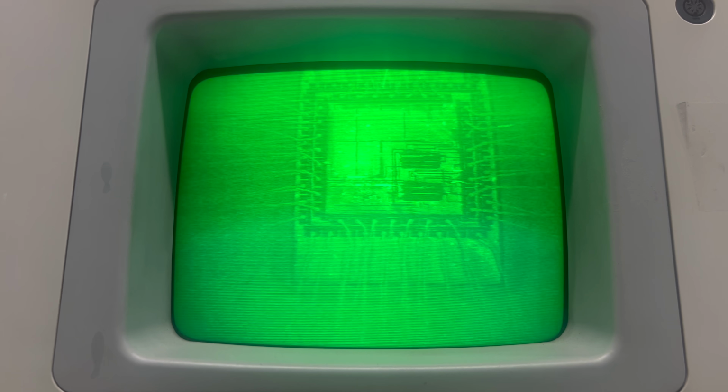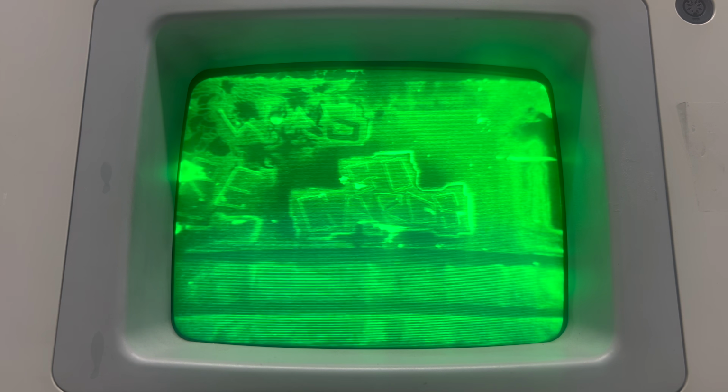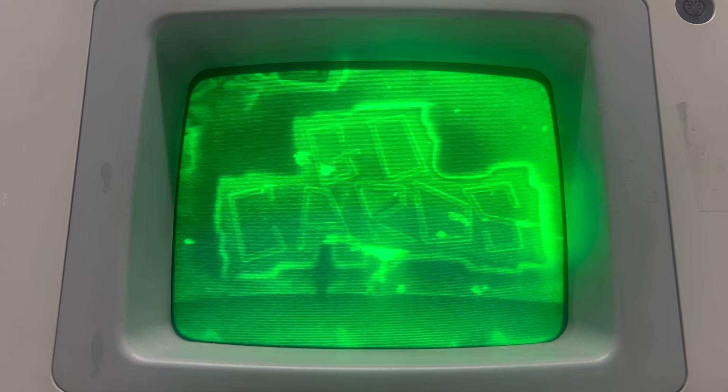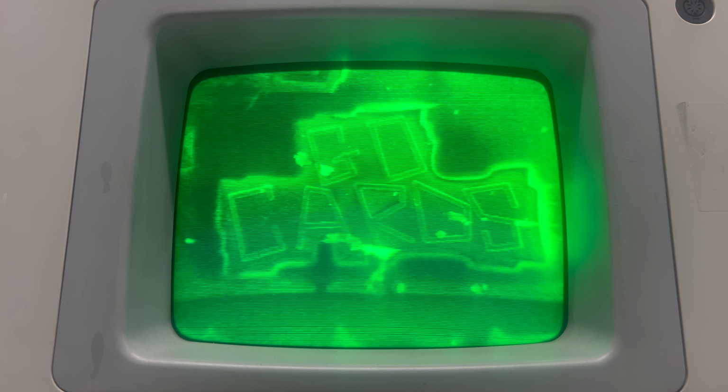Another amusing thing about integrated circuits is that occasionally the designers will have a little extra space on the silicon, and some designers will use that tiny space and write messages or graffiti. You can see that this designer wrote, "Go Cards," right here. I'm not exactly sure who the Cards are, but I'm assuming it's a sports team somewhere.